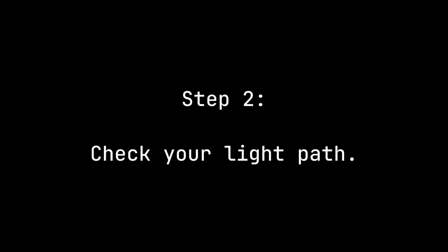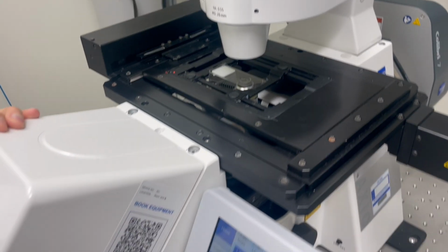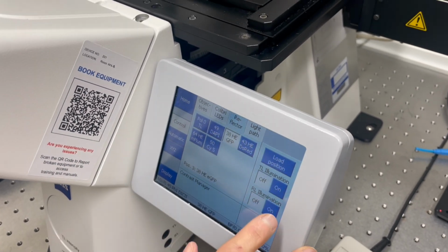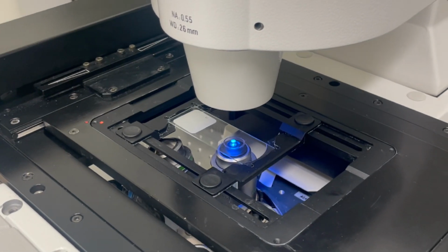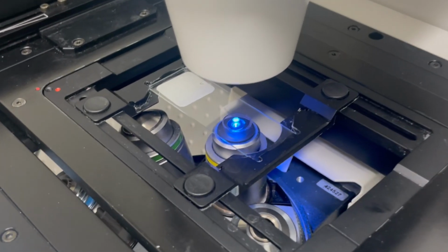Step 2. Check your light path. Make sure that your sample is illuminated. If you're trying to visualize, for example, green fluorescent molecules, you'll be exciting those with blue light. So, on your microscope, you want to check that the blue light is actually turning on when you hit on. If you don't see any light at the sample plane, that's an indication that the light is not on, whether it's the LED or the laser.